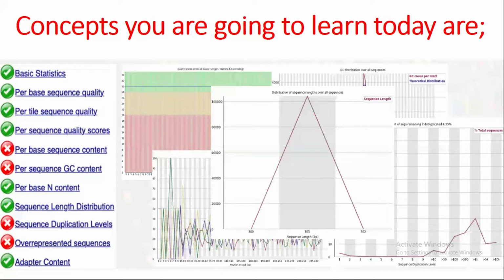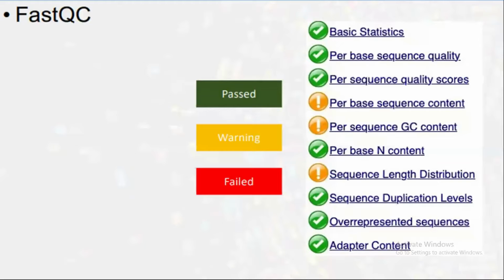Now we will start with the FASTQC reports. FASTQC reports basically have three types of colors. One is green, which means passed. The second is warning, and the third is failed. So green, yellow, red. When it is green, it is okay. When it is a warning, it is also okay, although you can perform pre-processing to clear that warning and make it pass. But if you are not worried about it, a warning is also okay, and you can proceed with your data. But if there is a failure, then you have to pre-process your data according to your understanding.